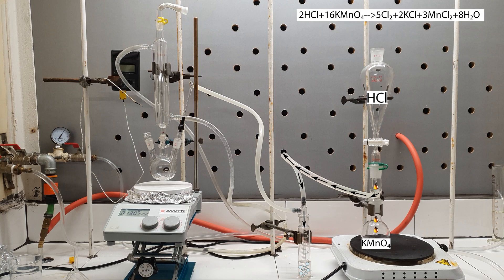Keep in mind that iodine monochloride is specially reactive towards water, and any of it present will reduce the yield. The dried chlorine is then passed in the three-necked 100ml round bottom flask, where it will react with the iodine. The central neck of the flask is equipped with a reflux condenser to catch any vapors that come off. And finally, to keep all the moisture away, the top of the condenser is equipped with a calcium chloride tube.